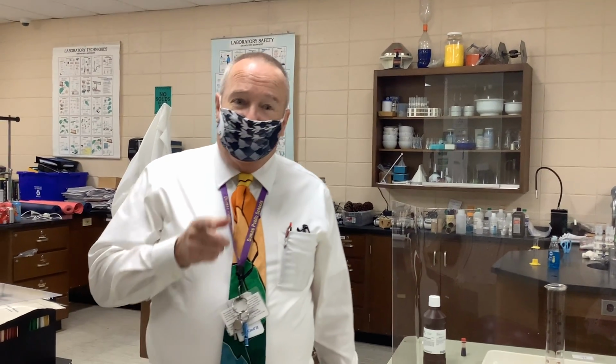Hello, my dear students, and welcome to our lab demonstration on the famous, classic chemistry lab experiment called the elephant's toothpaste, sometimes called the devil's toothpaste or dragon's toothpaste. This is a classical experiment frequently done at younger grades and younger ages, and a frequent YouTube experiment, but it actually is quite a good demonstration because it involves replacement reactions, degradation reactions, a quick discussion of thermodynamics, and a great example of an exothermic reaction.